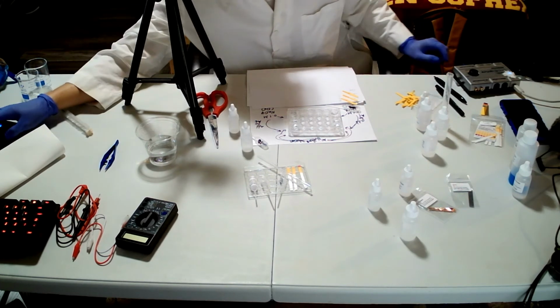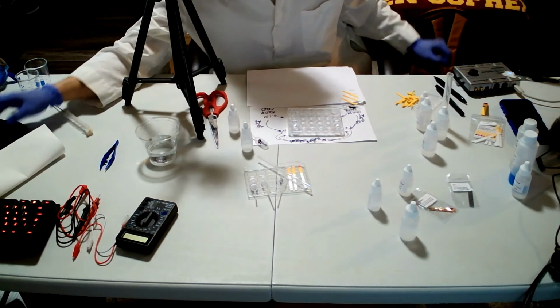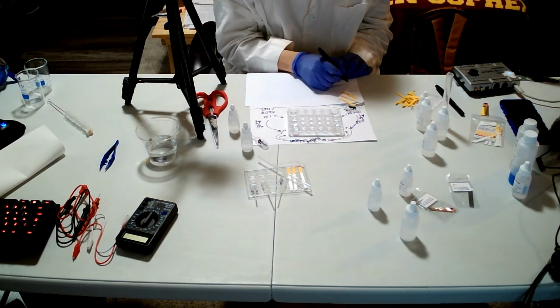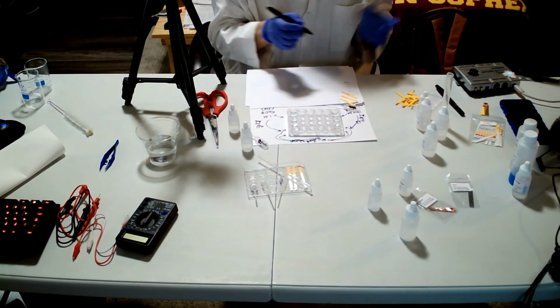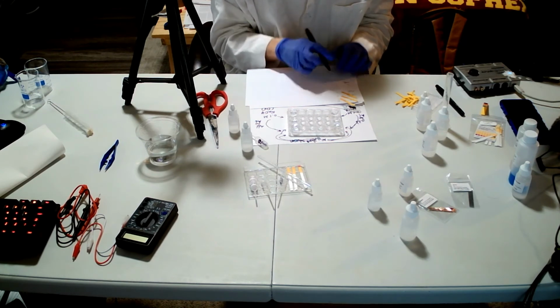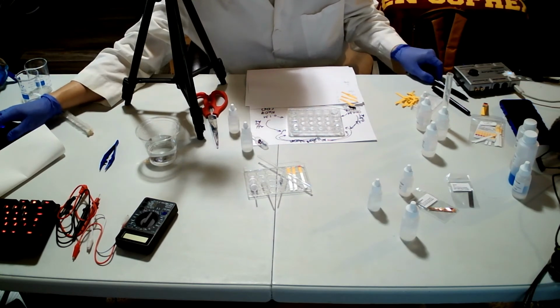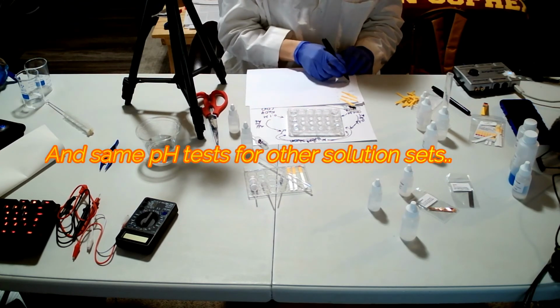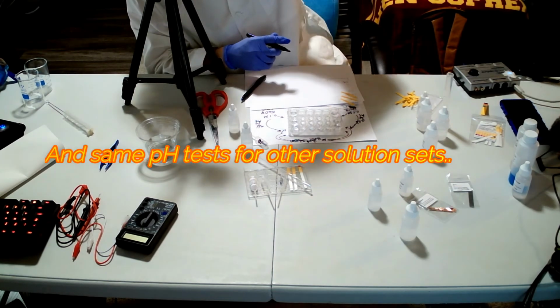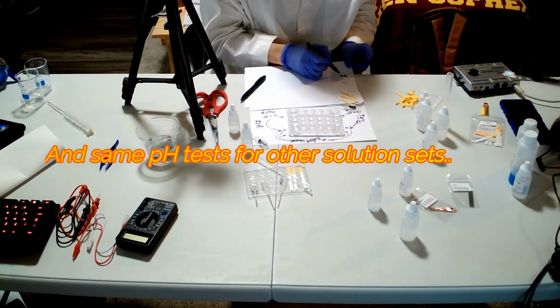It doesn't really change, and you do this over and over to maybe 16 drops, as following the given data table, right? You keep filling those as well, and then that was data table 1.